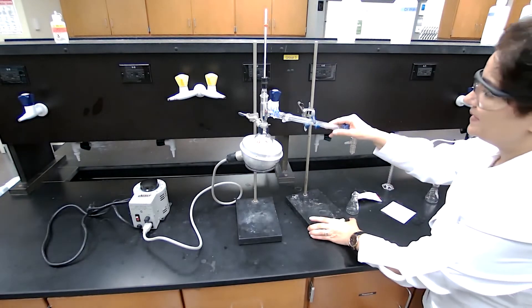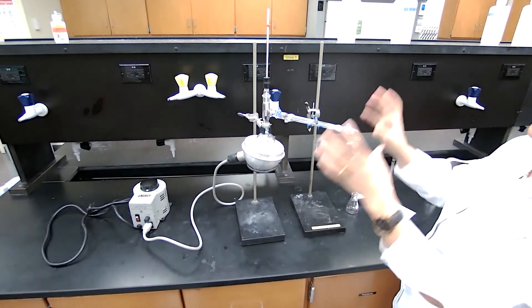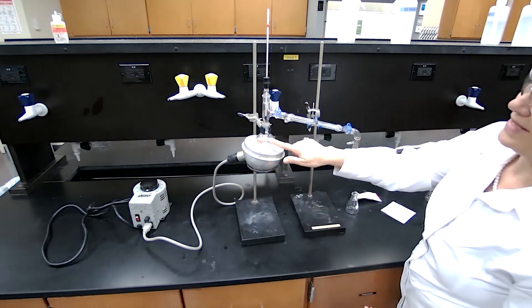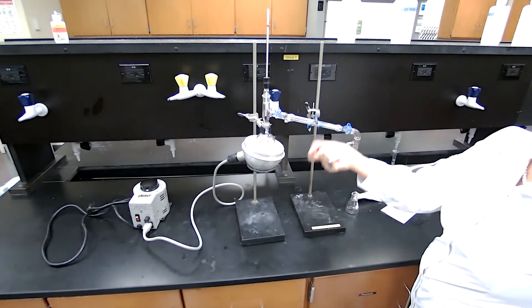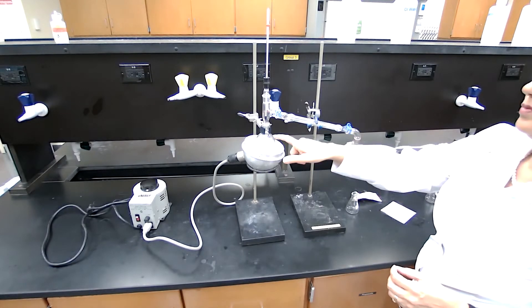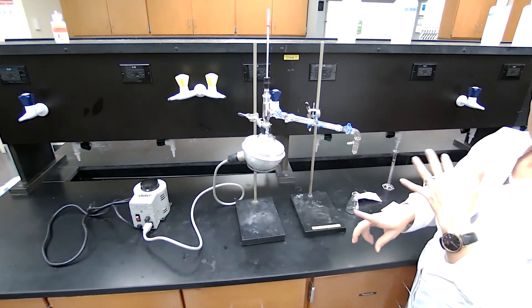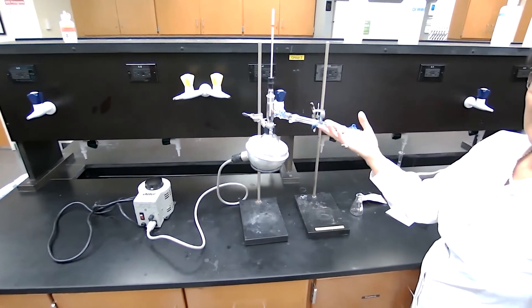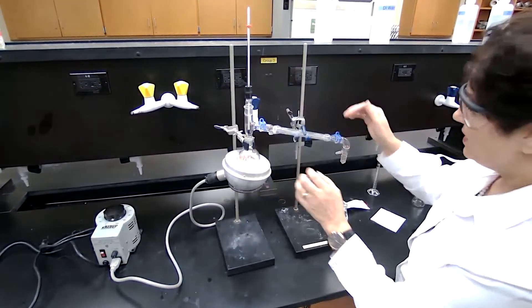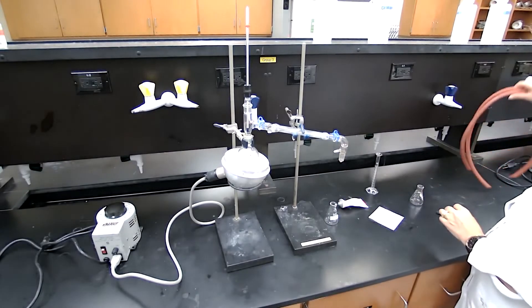The setup for simple distillation is now complete. I complete the setup, then easily I lower the heating mantle to remove the flask and add my chemicals because my chemical, the chemicals that I'm using is volatile liquid. I don't want to leave it in the flask and finish the assembly to avoid any spillage, to avoid evaporation of that before I start collecting. The glassware are now, except the receiving flask, are complete.